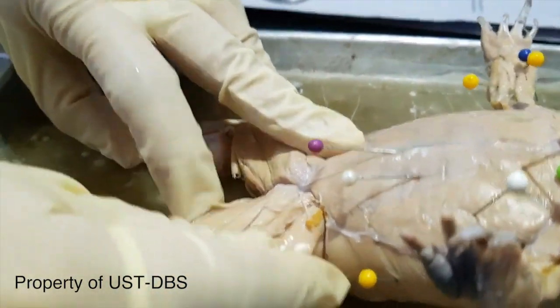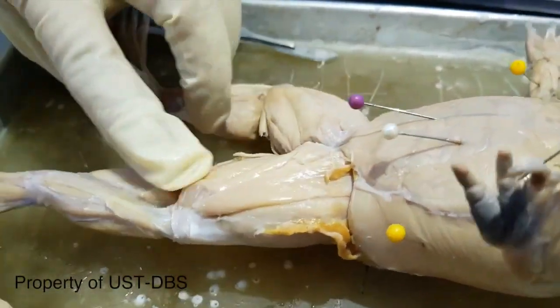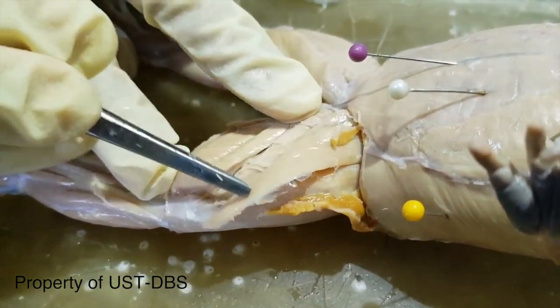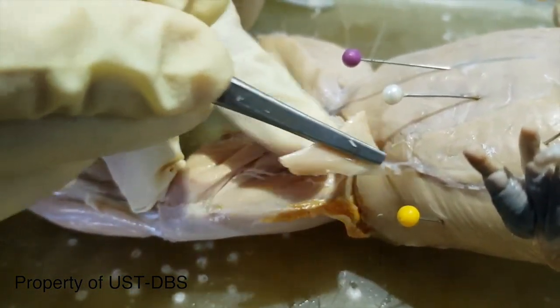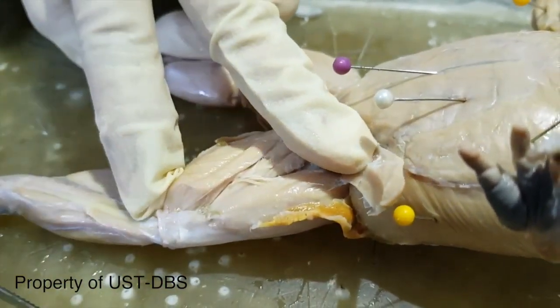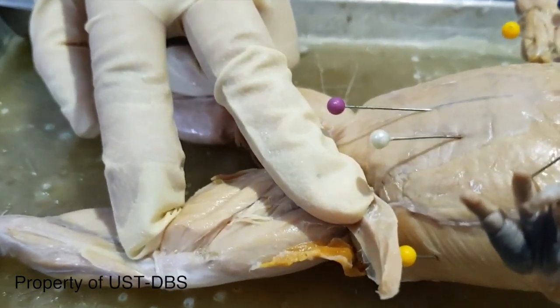Then we'll go to the legs. This thin flap of muscle that I already removed is the sartorius. You have to remove or deflect that one in order to reveal the underlying muscle.